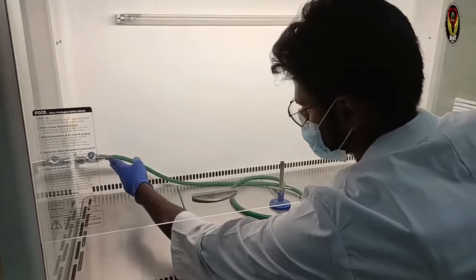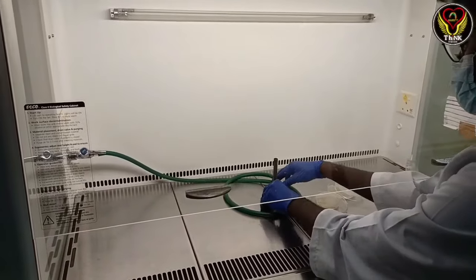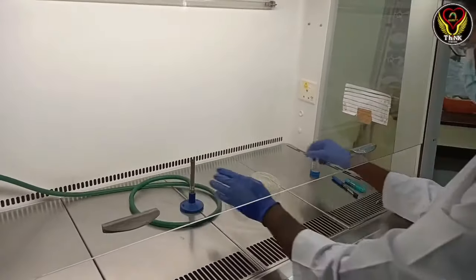Now we are coming to the important part of the video. Let's take 10 minutes and put the gas on and turn it on.